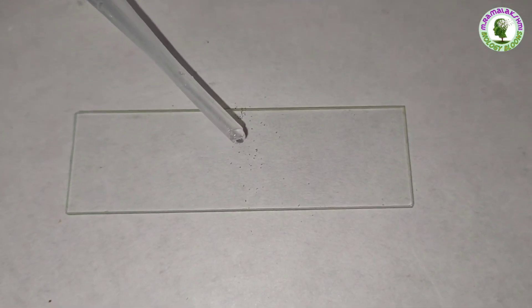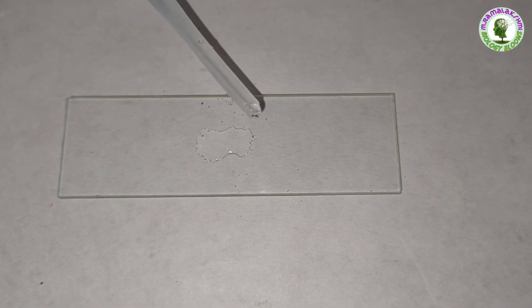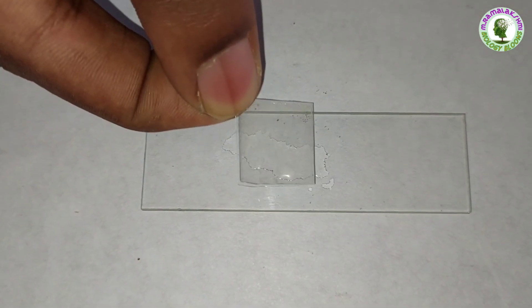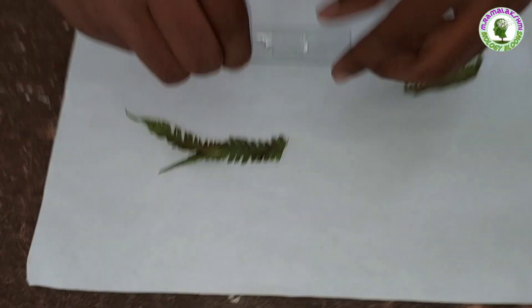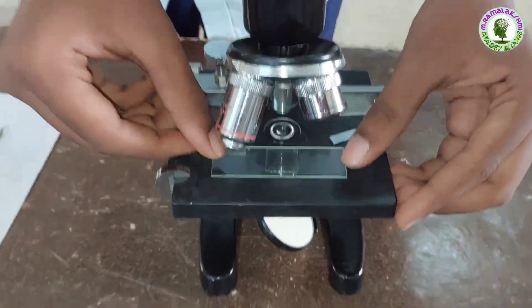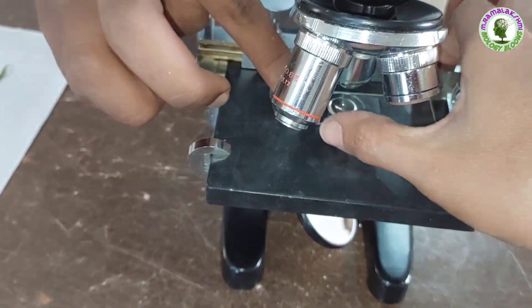Collect it on the slide. Put a few drops of water on it. Cover it with the cover slip. Now place the slide under the microscope and observe the spores.